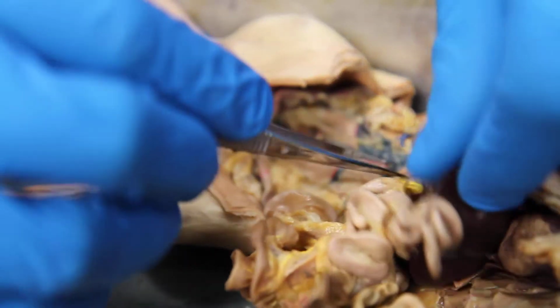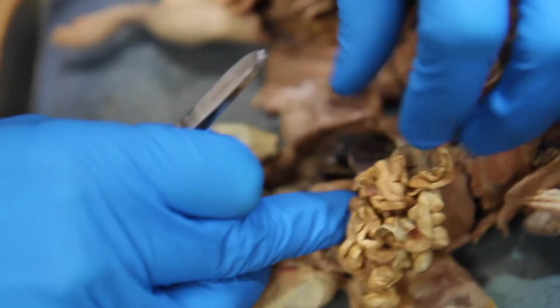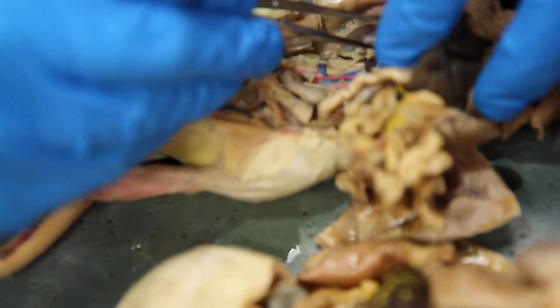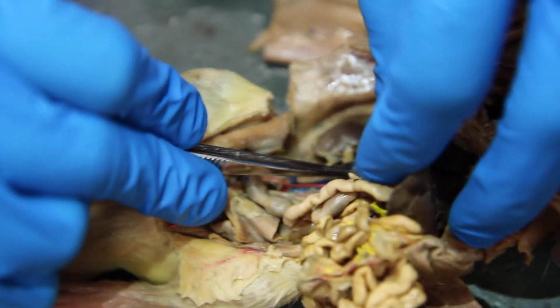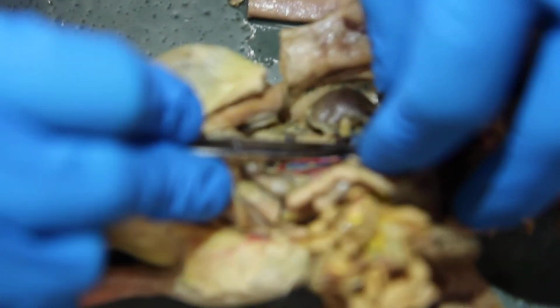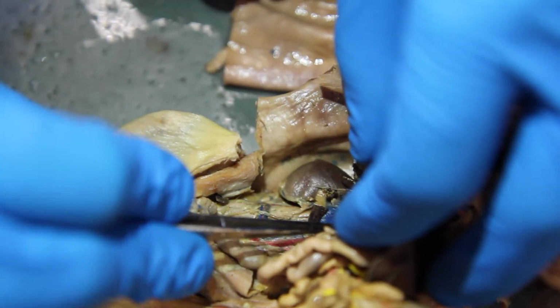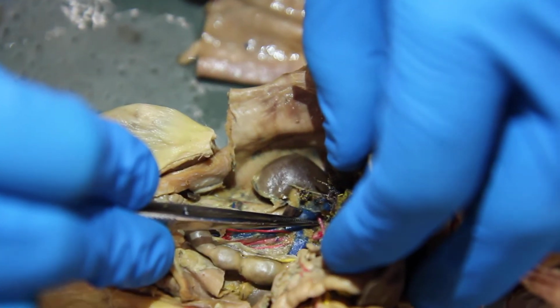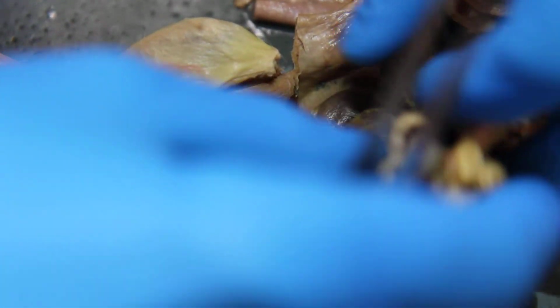right kidney. And this one's awesome because it's covered by the vena cava. Right there, this artery right here. That's one of the renal arteries. This is the right renal artery, but just for this renal artery, that's fine. It's coming off here, going straight over. The next thing down is the cranial mesenteric, and it's going to the intestines.